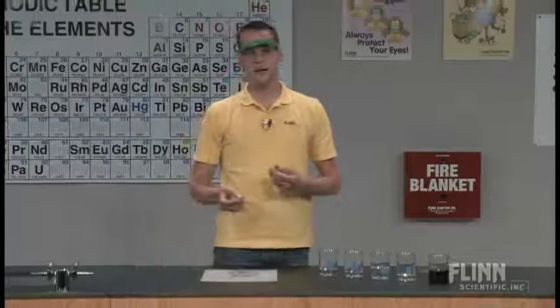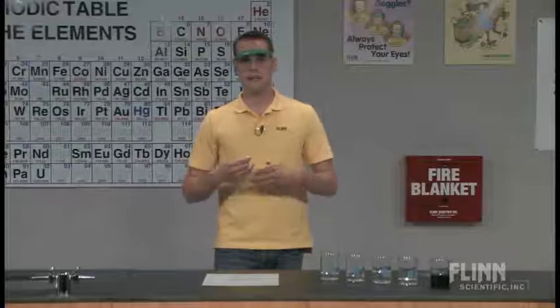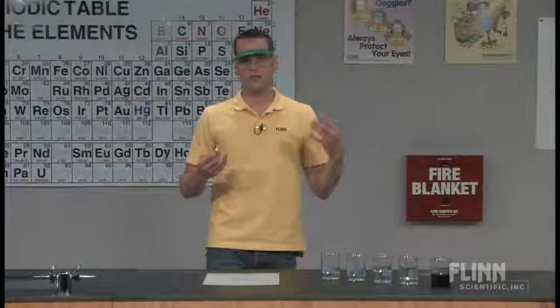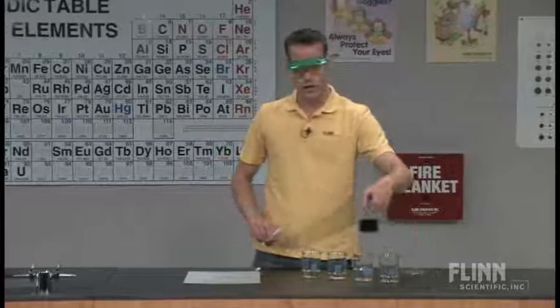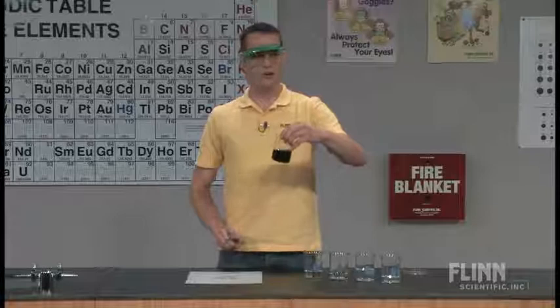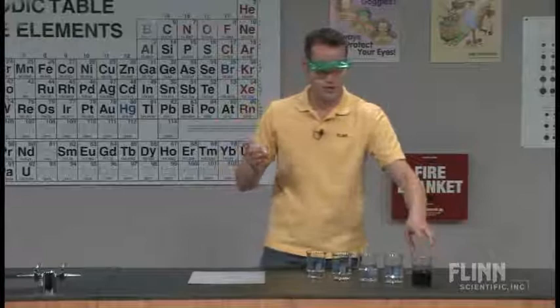But what this does allow you to do is to separate a mixture that students are very familiar with. One of the things I'm always striving for in my classroom is to use an everyday example or something that students recognize from their daily life. So the mixture we're going to be using today is grape Kool-Aid. This is just regular, ordinary grape Kool-Aid without the sugar.